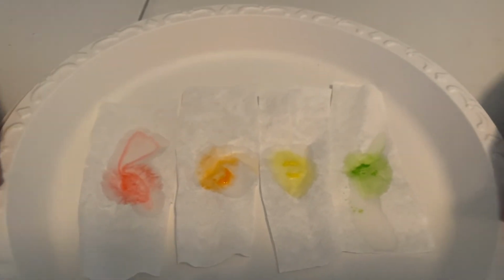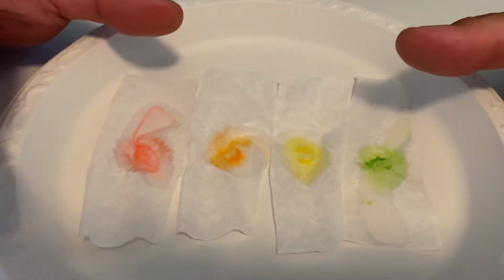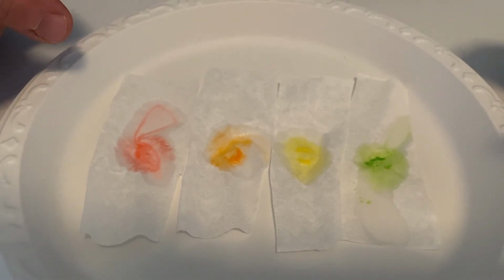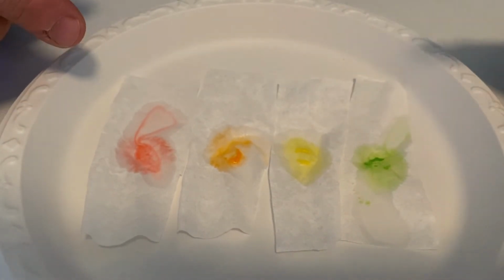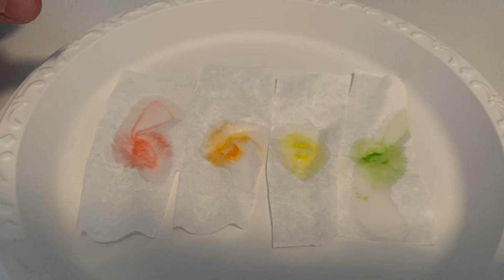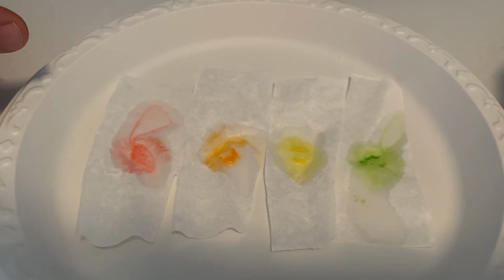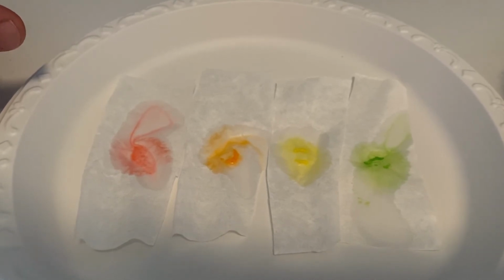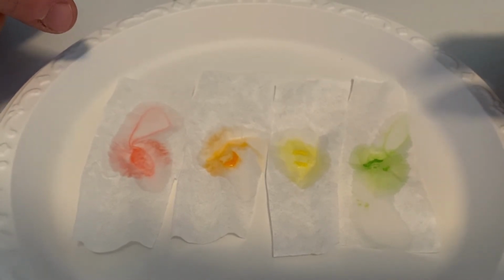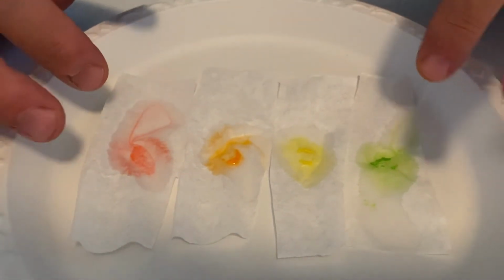Okay, so check that out. As we're sitting here observing, we see that it is starting to spread through, right? The color starts to separate into different bands. The colors of some of the candies are made from more than one dye. Those are typically going to be your secondary colors, not your primary color ones, but your secondary ones are definitely made of more than one dye. We use the alcohol instead of water because rubbing alcohol affects the dyes differently, and the dyes travel farther than it would have with the water.